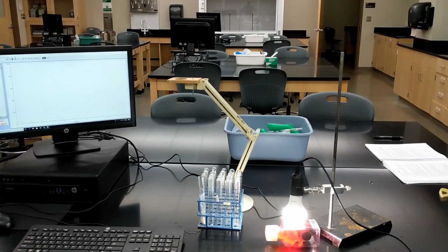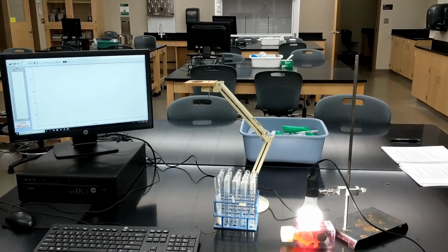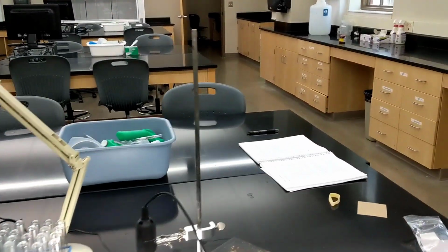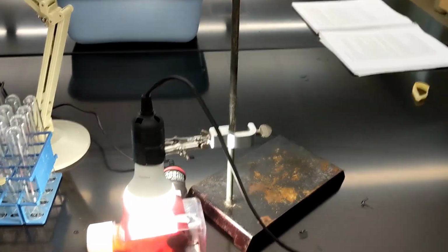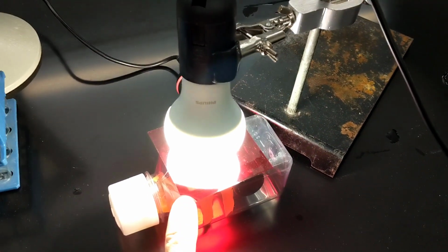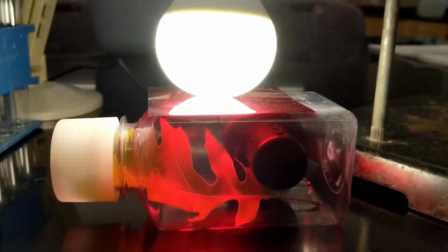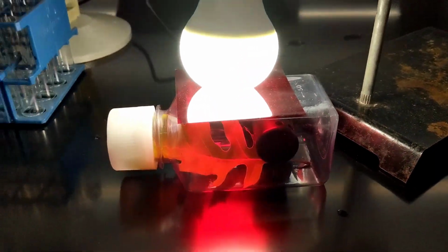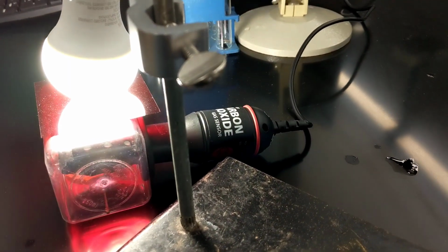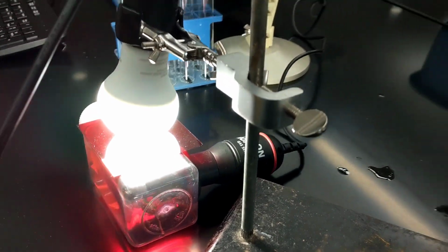Today I'm doing a video showing you how the photosynthesis experiment would be set up if we were meeting in person. So what do we have going on here today? We have a light, a white light, you can see here, quite bright. It's an LED light. We have in this case a red filter. And down here we have a leaf inside of this container. I laid it in there as flat as I could so it would be exposed to the light. If we were doing this in lab, we'd use spinach, but I grabbed an oak leaf from outside. And we have a carbon dioxide probe right there. It reads concentration of carbon dioxide in the atmosphere.